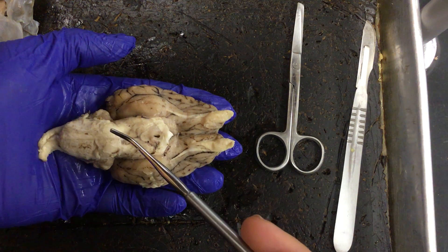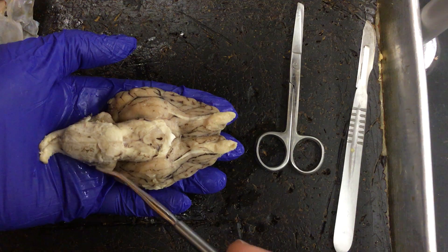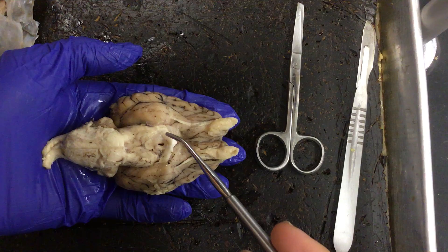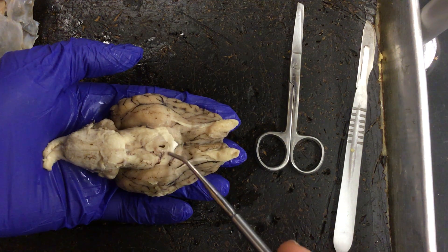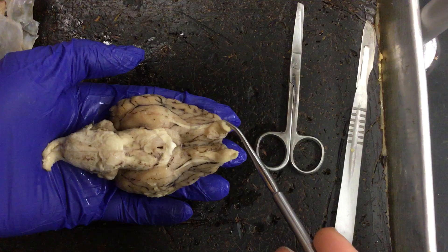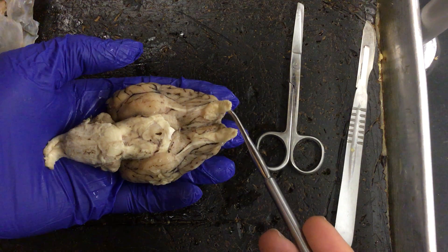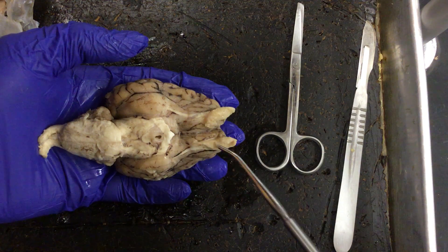After identifying the pons, medulla, and cerebellum, we'll move forward and look at the optic chiasm right here, and then the olfactory bulbs — particularly large olfactory bulbs in a sheep, especially compared to humans.